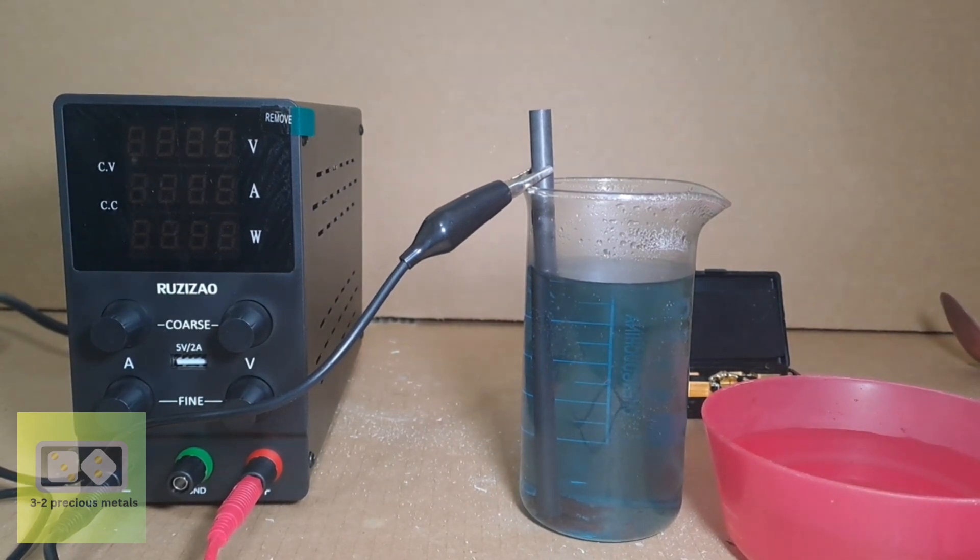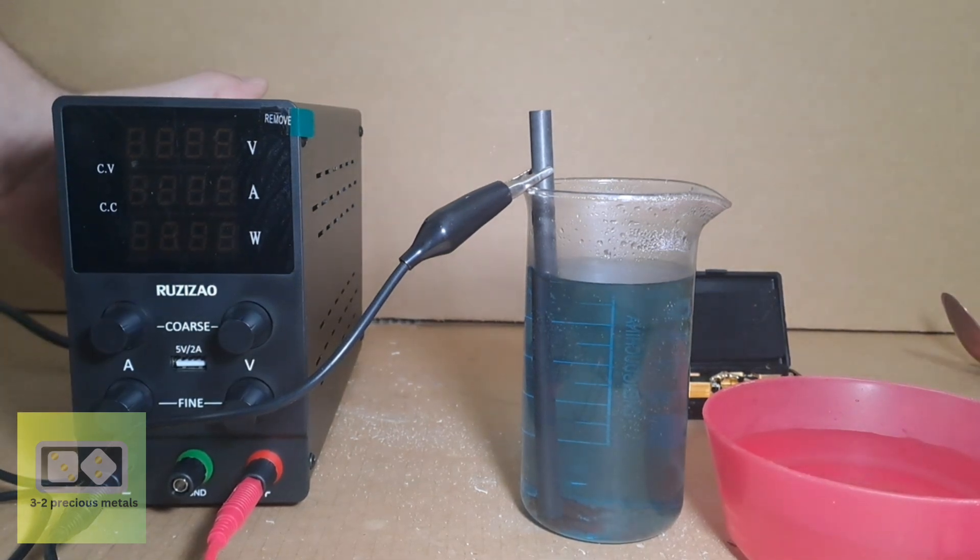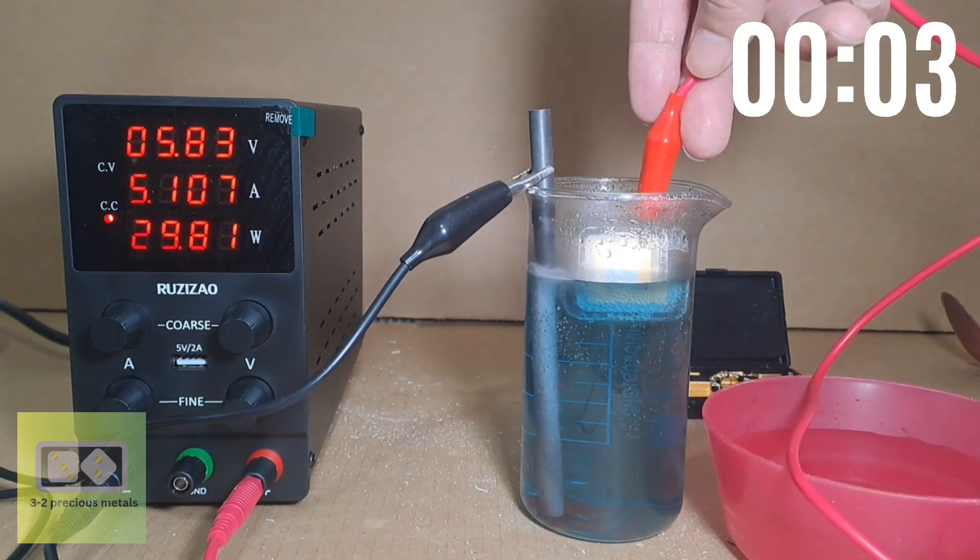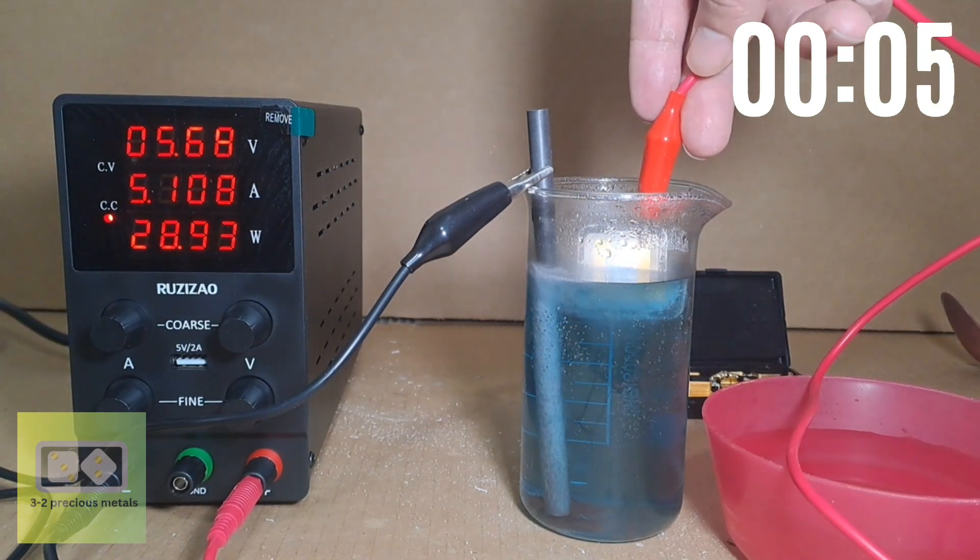I'll turn on the power supply and get started. And I'll put a clock up in the top right hand corner so you can see how long it takes. And whilst that is running I'll explain the equipment setup.